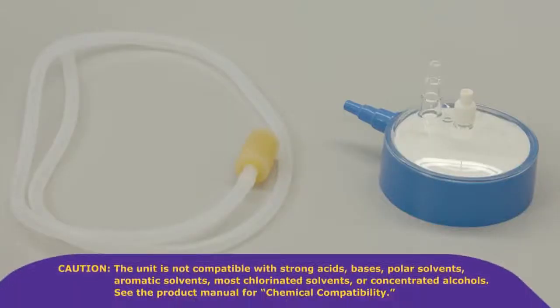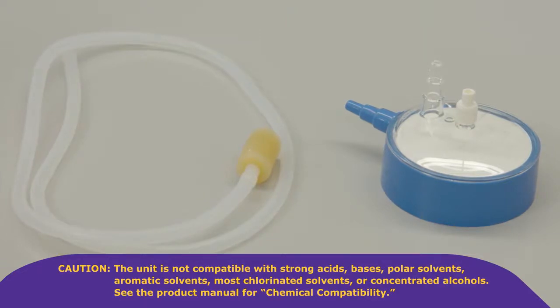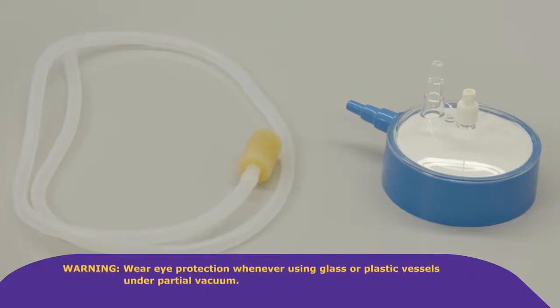Caution, the unit is not compatible with strong acids, bases, polar solvents, aromatic solvents, most chlorinated solvents, or concentrated alcohols. See the product manual for chemical compatibility. Warning, wear eye protection whenever using glass or plastic vessels under partial vacuum.